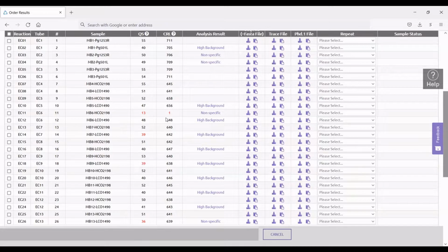And so this sometimes happens when you run your bands on the gel. You can't always tell that both primers functioned properly in attaching to the sequence of interest. And so in this case, the reverse did not work, but the forward did. And that's why I always suggest to people that I'm instructing to sequence both the forward and reverse directions, not only to create a consensus sequence ultimately for use in analyses, but also in case one of them does not amplify, then you at least have something to look at.